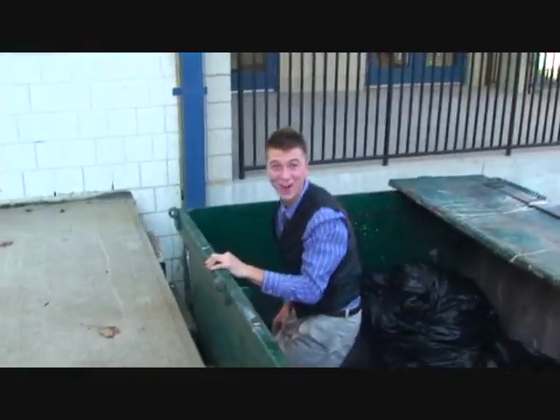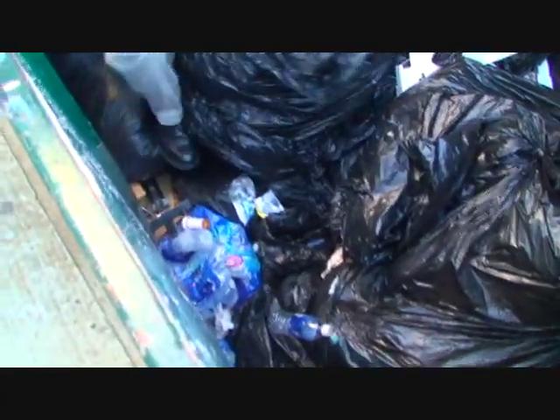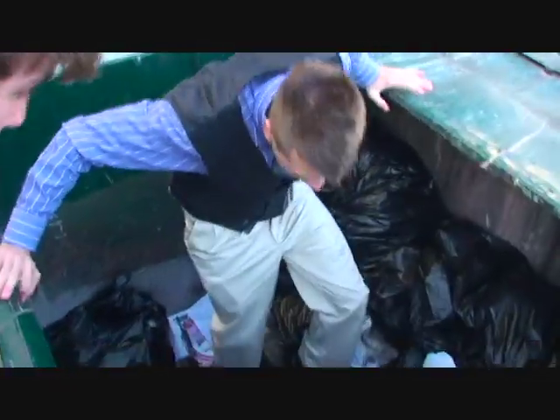What are you doing in here? Get out of here! Safety goggles are lost! Where'd they go? Yo, where'd the goggles go?